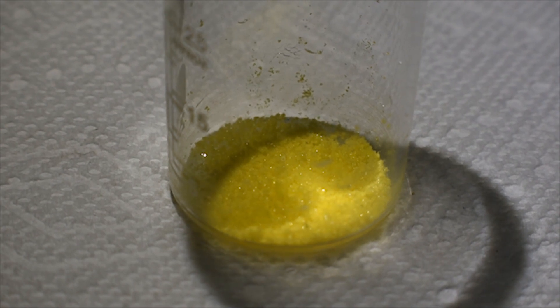Here's the final product, a greenish-yellow crystalline solid, weighing 0.88 grams.